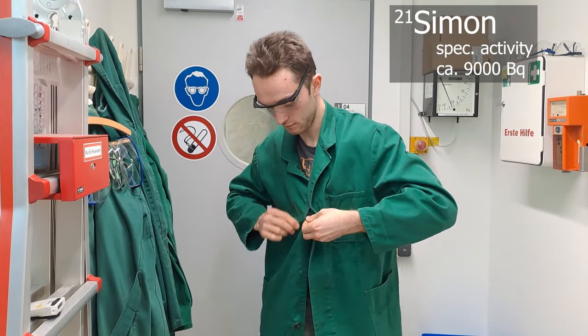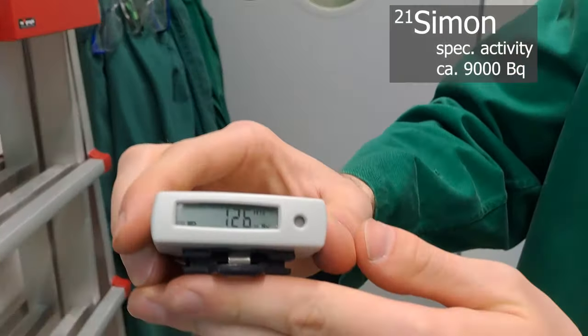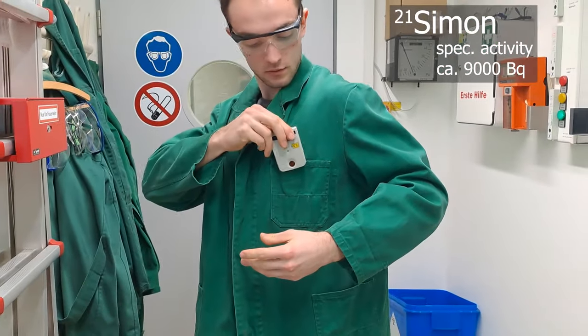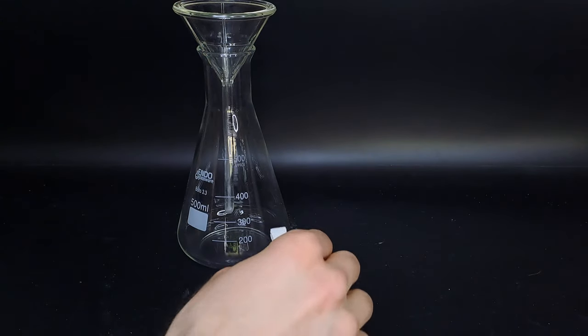With a half-life of about 1 billion years, it's responsible for half of the 9,000 decays that occur in the human body naturally every second. Today, I will be extracting this potassium from the bananas.